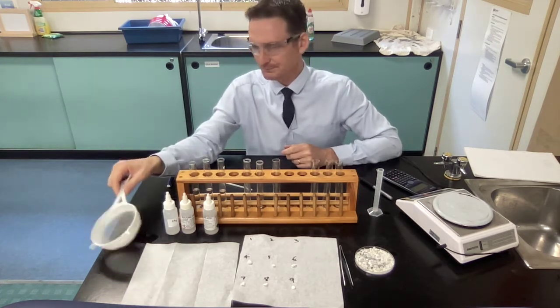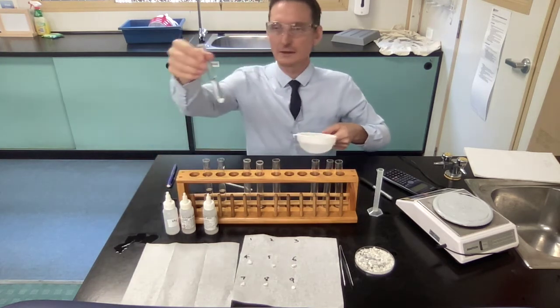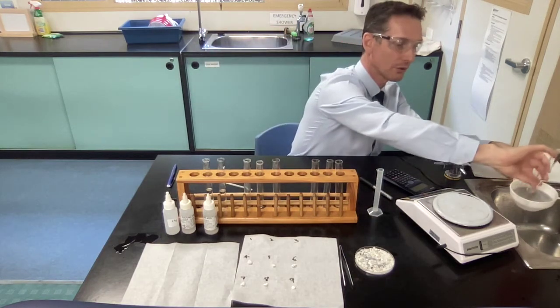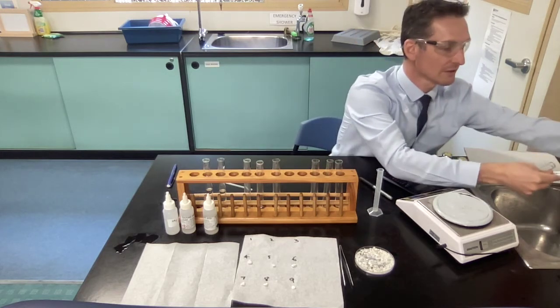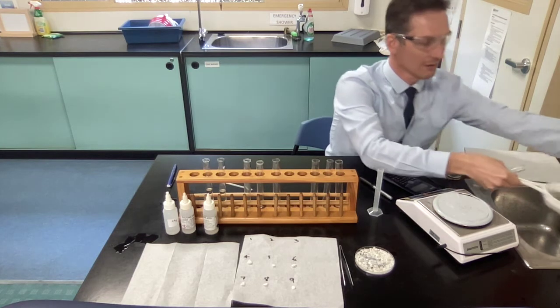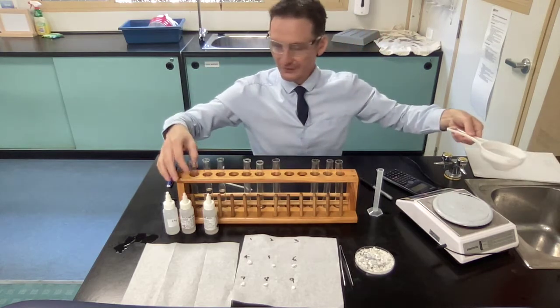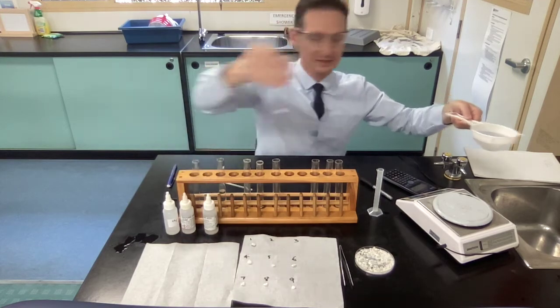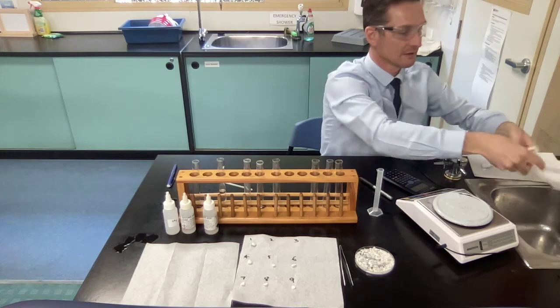You get this plastic sieve and you're going to take your solution over to the sink. You're going to just pour it through into the sink, and then, seeing it's got acid on it, you're going to just wash the sieve and wash that rock for about 5 seconds in water to get all the acid off, and then you can just place it back down in number 1, because that came from number 1 test tube.